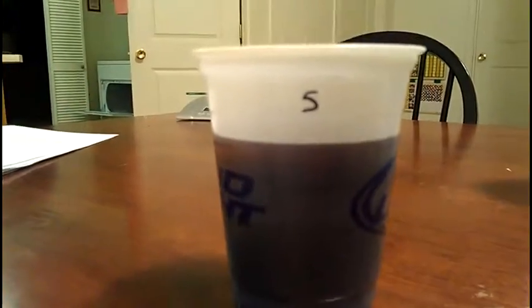So it's hard to tell, but the light's not very good, but you can see that there is a difference in them. It's not nearly as defined as the last experiment. It more just goes from darker to lighter. I think they blend a little bit more than the other ones did.